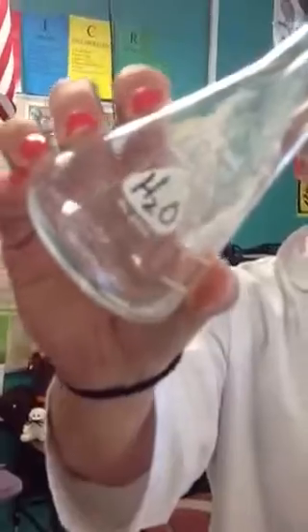When you start your lab, you're going to get a 125 mL Erlenmeyer flask. If you notice, this one's a little dirty — really that's just dried phenolphthalein. But we want to rinse it out just in case there's any leftover acid or base, because we want to get as accurate a reading as possible. So we're going to rinse out our flask to start.